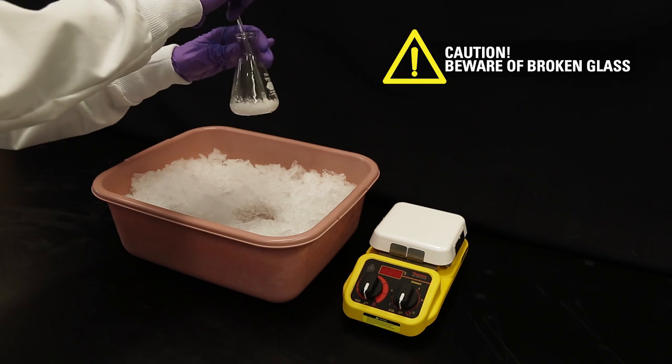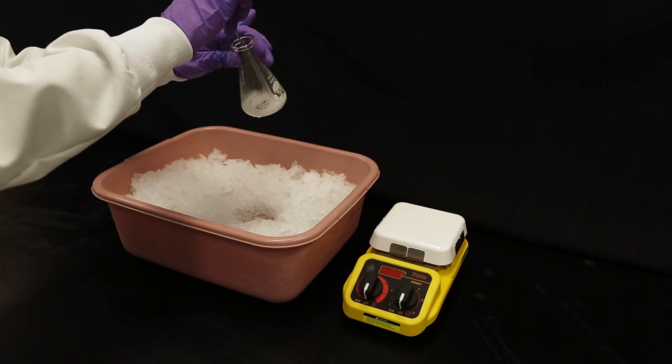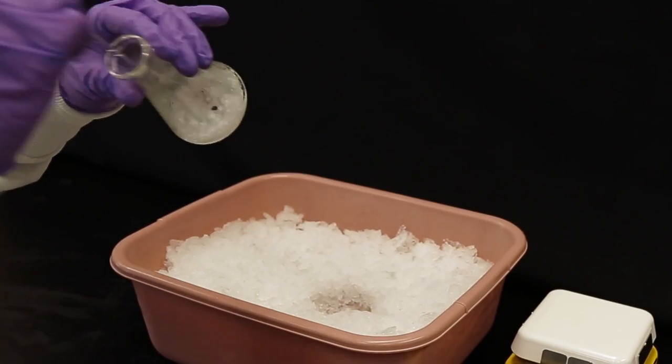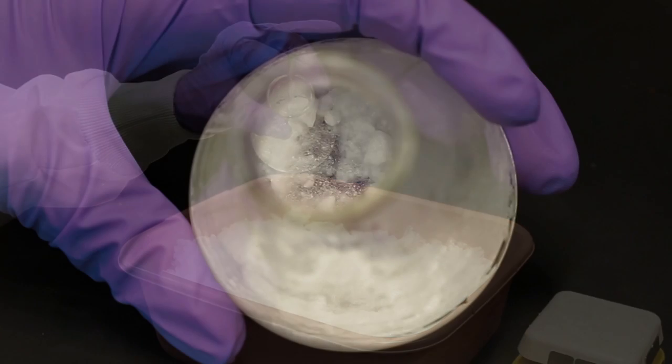Be gentle when scraping. Glass rods are fragile and may break and cut your hands. Since crystal formation generally excludes unlike molecules, or molecules that are still solvated, this process greatly removes any residual salicylamide present in the initial crystalline material.